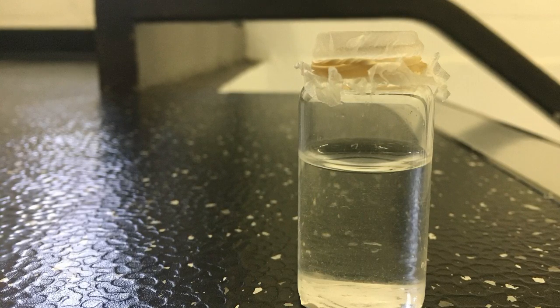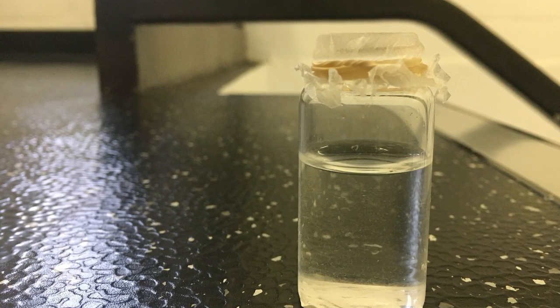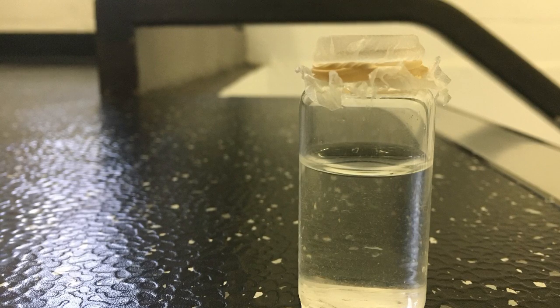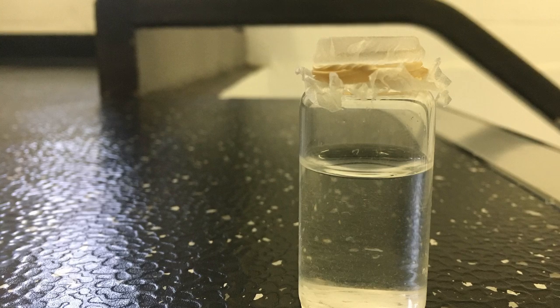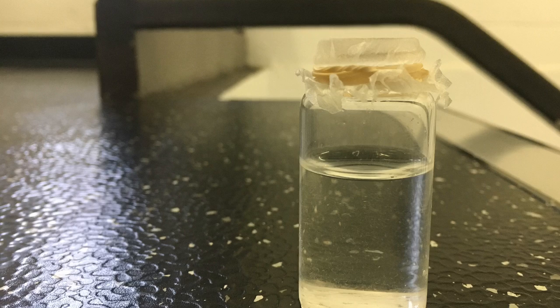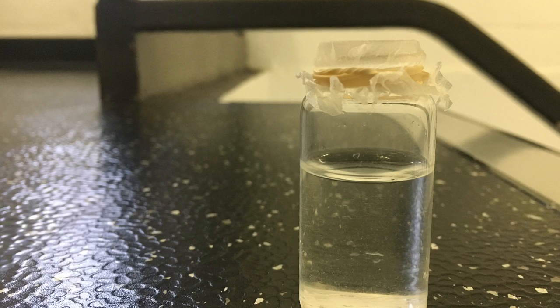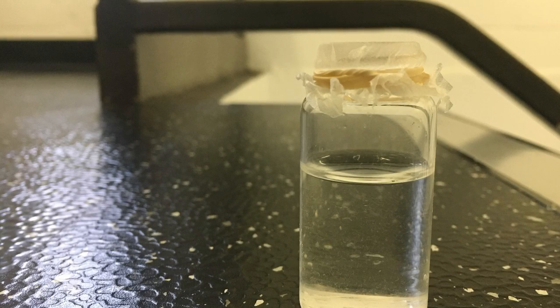Part 3 of this lab involves recrystallizing the alum crystals inside a 20 milliliter vial. The first thing you must do is obtain this 20 milliliter vial and label it with your initials, the date, and your lab time. Then you must measure out approximately 5.64 grams of alum to saturate and pour into a beaker filled with water. Our lab group massed out approximately 5.7066 grams from an amount of 7.1810 grams of alum produced during parts 1 and 2.